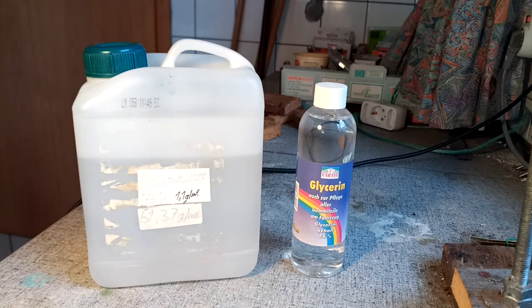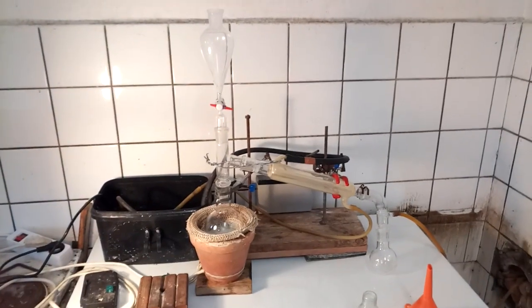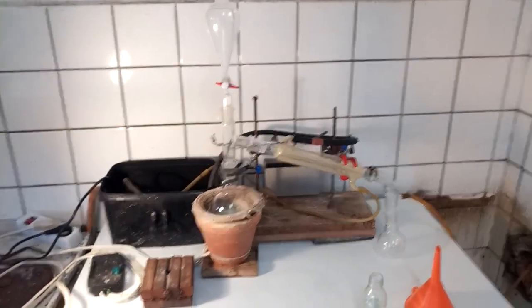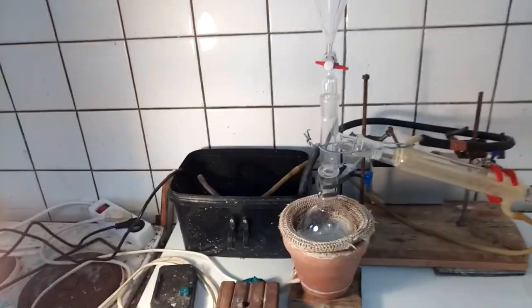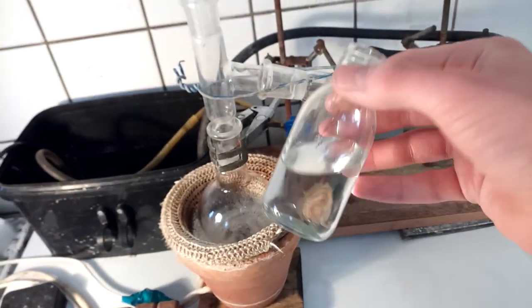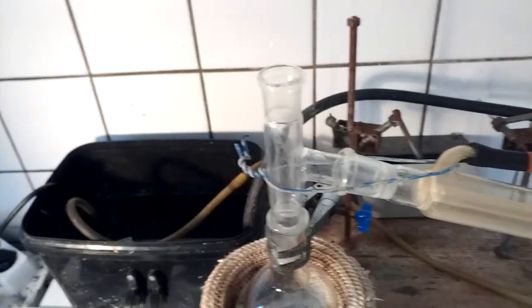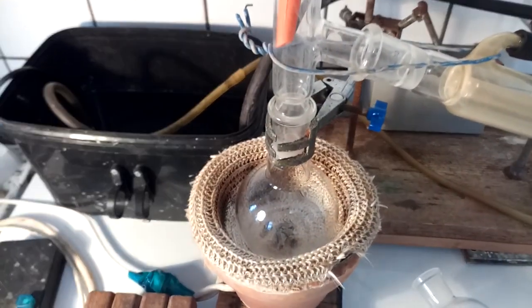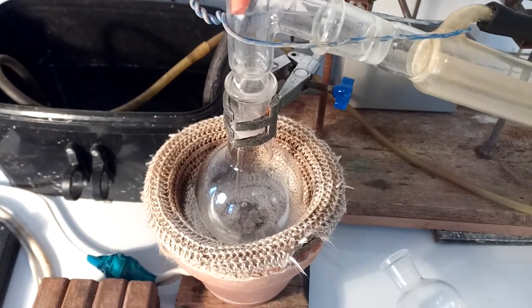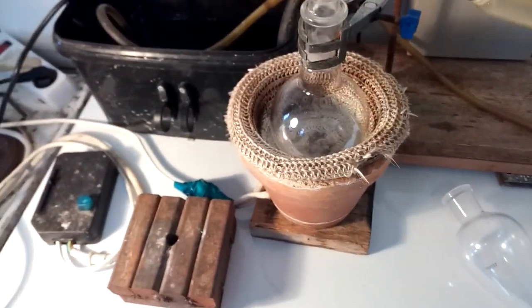I've put the formic acid aside for now and already assembled the reaction apparatus — basically just a simple distillation setup with a separatory funnel on top. I'm going to put my 86% glycerin in there; I've weighed out 65 grams of it, which should be enough for this synthesis. I'm already going to heat this up a little just to drive off the rest of that water, and then I'll add the formic acid and do the actual reaction.